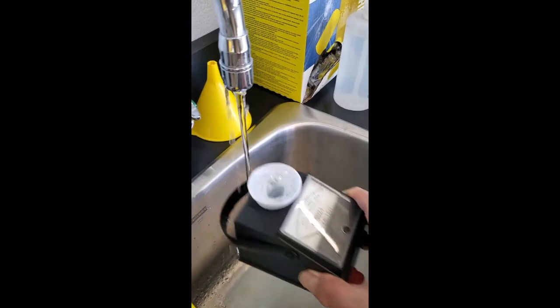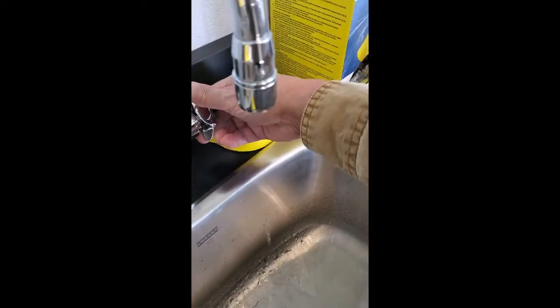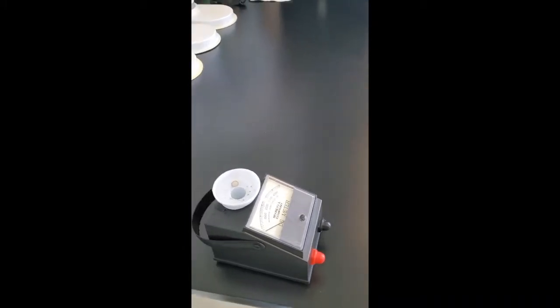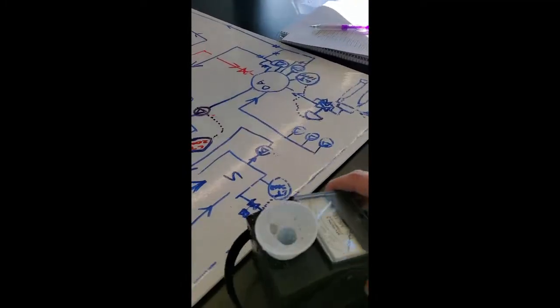Now I take a sample. I'm going to turn it off. Okay, now, so in here, maybe I'll take it over in here. Okay, everybody can take a look. Okay, from here.